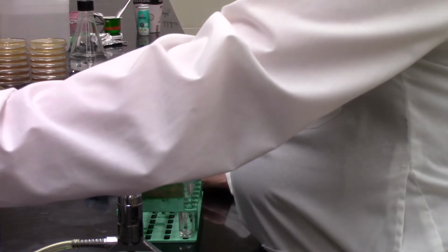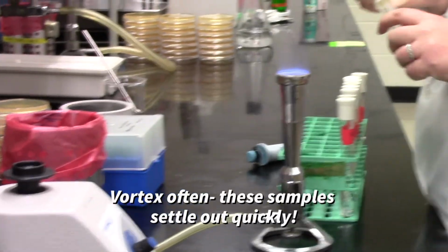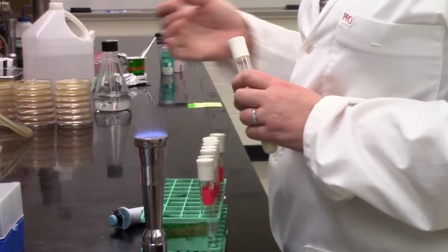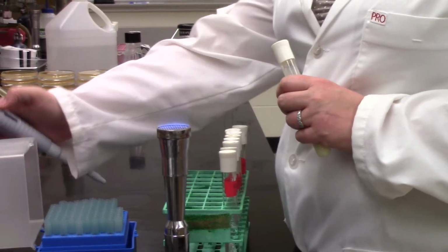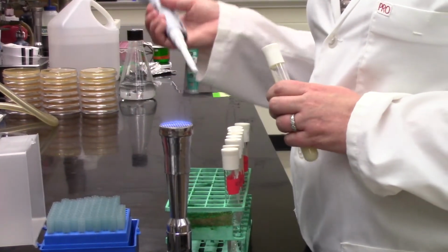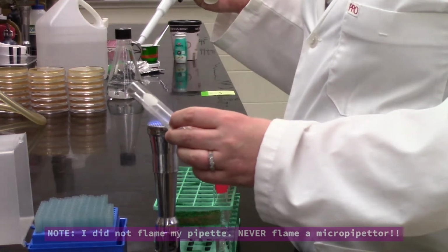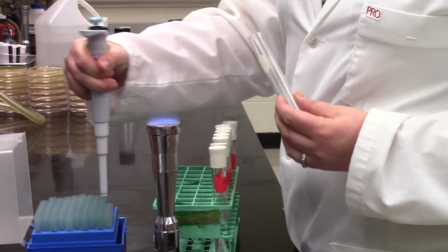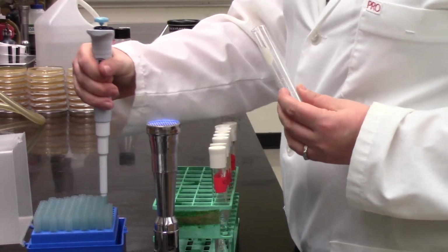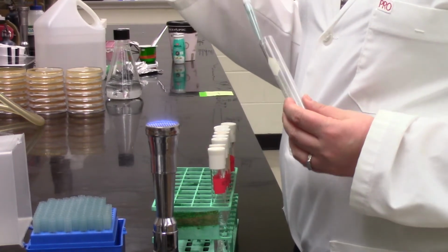So Sabrina's going to get started by vortexing again. There's been a break since we last vortexed that. So the last thing you do before you do any transfers in a dilution series, any movement around, is always mix. Because uneven mixing is probably one of the biggest problems for having a dilution series that doesn't give you accurate enumeration.